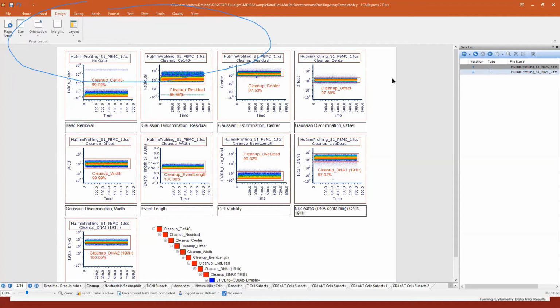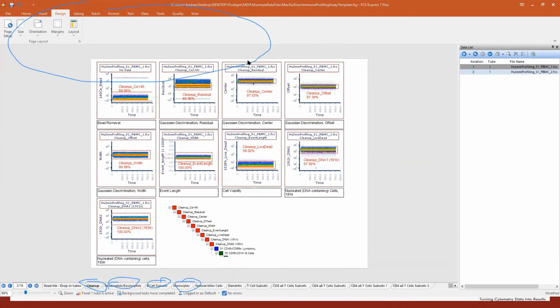You can see here that I do have many pages. This is 1, this is 2, this is 3, this is 4. I can scroll through pages exactly as I would in PowerPoint. I call them pages, you can call them slides. It's up to you. Let me zoom out a little bit so that you can see it entirely. So usually in this case, you want to start with a cleanup page. So here you see I have all my cleanup plots.